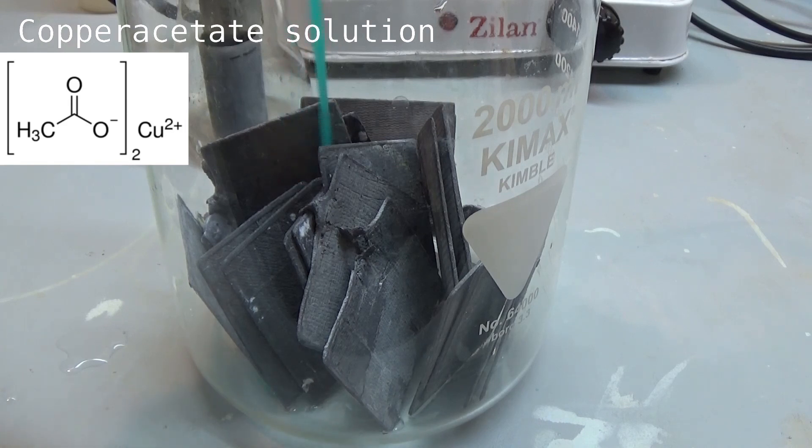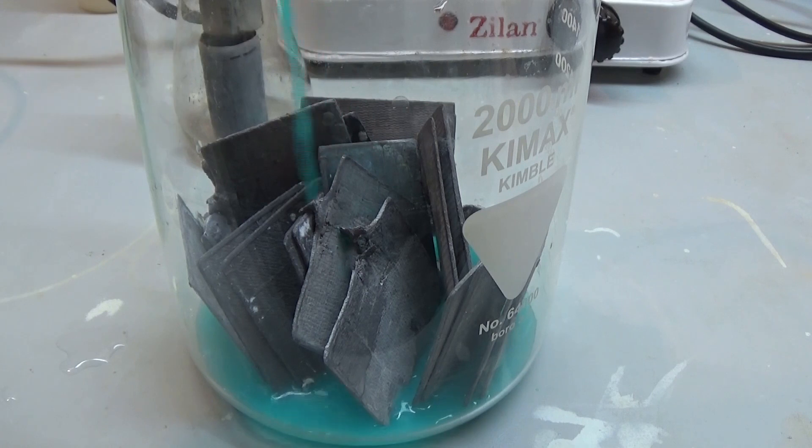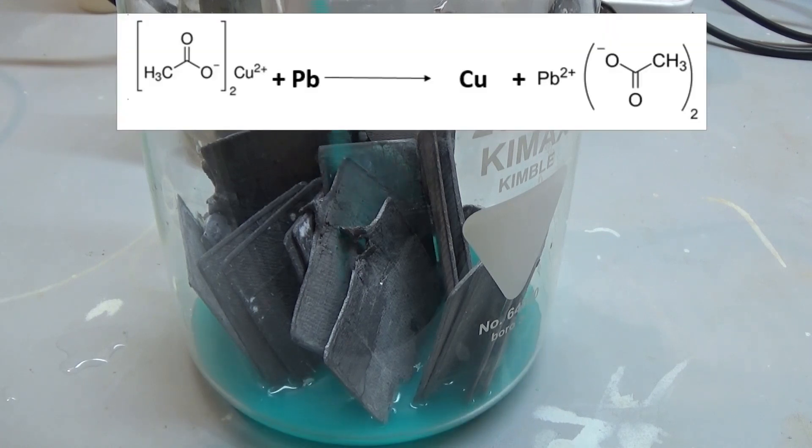For this reaction we really only need copper acetate, which I made in an earlier video, and elemental lead. To perform the reaction you have to bring the copper acetate into solution and put the lead into this solution.